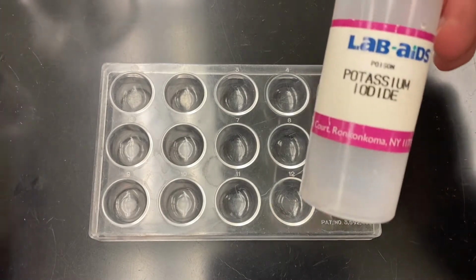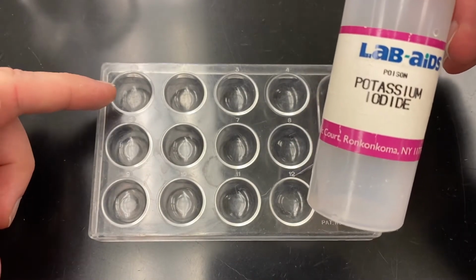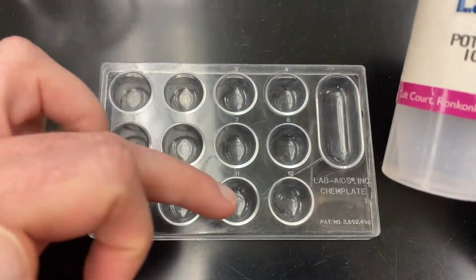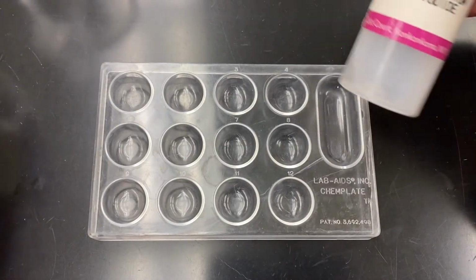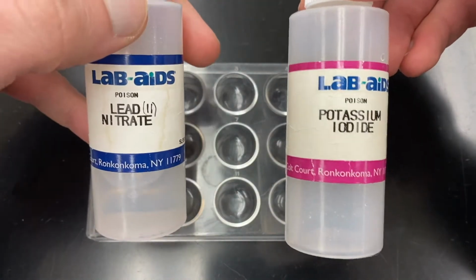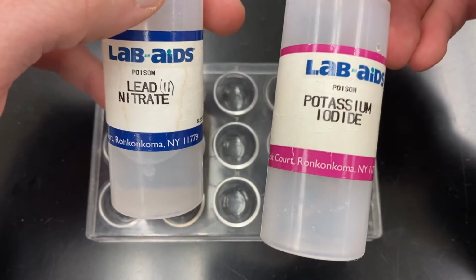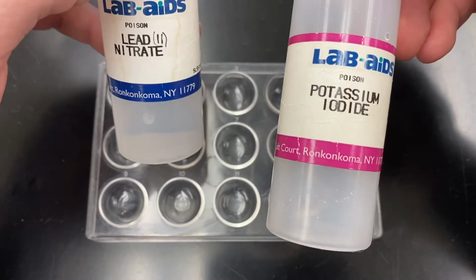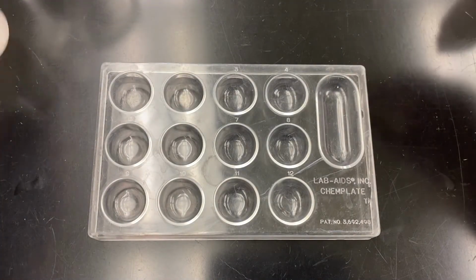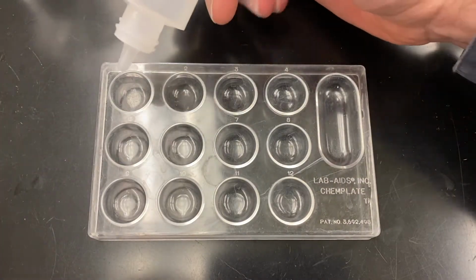Starting with the first cell and using potassium iodide, I'm going to have 11 drops, then 10 drops, and then 9 drops, and then 8 drops, 7, all the way down to 1 in the 11th cell. And what that will do is alter the ratio in which I'm combining these 2 substances throughout the experiment. And so by looking at the results, I can make a determination as to what is the best ratio for combining these substances. And so I will start off with my lead nitrate.